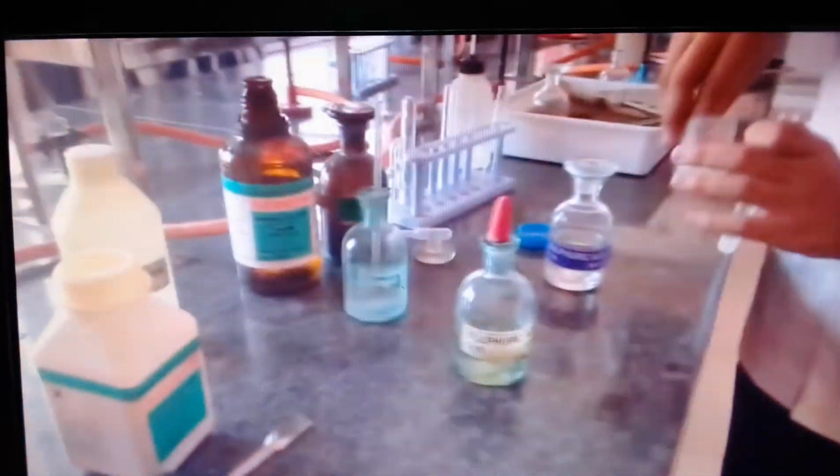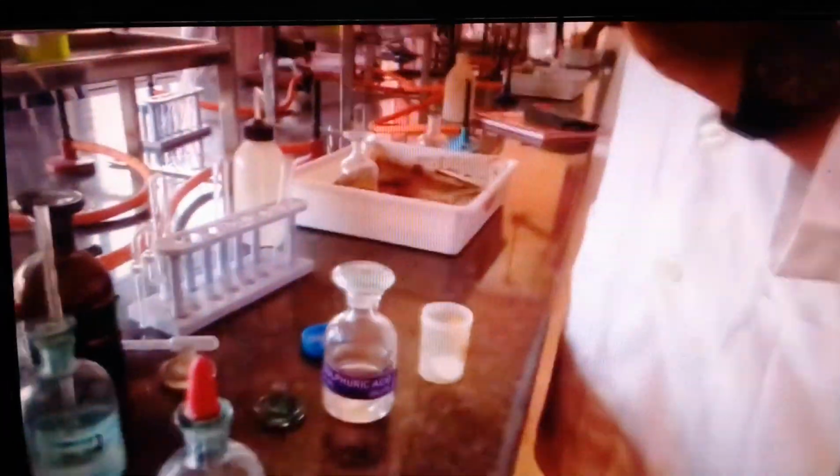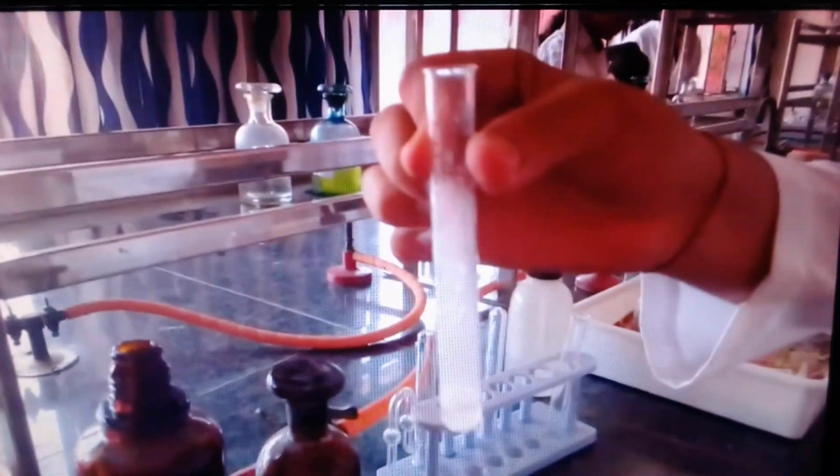Add a little more of salt to the test tube. Leave the glass rod. Add a little more of salt. And be a little quicker because the gas perhaps has already escaped. Fine. Add sulfuric acid and quickly then bring the glass rod with the ammonia. Yeah, you can see the evolution. Fine. That's one of the preliminary tests to show that it could be a chloride, and you can see the whole test tube is in fumes of ammonium chloride.